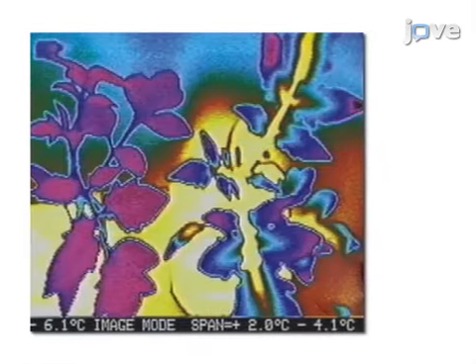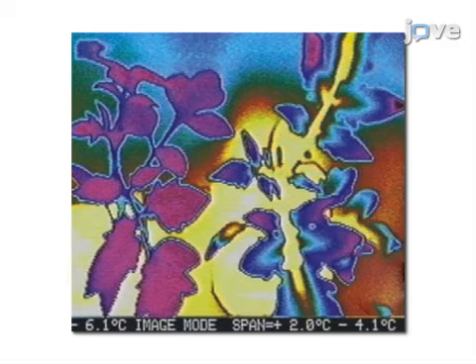The results show the effect of extrinsic ice-nucleating agents to induce plants to freeze rather than supercool and avoid freezing, based on the ability of infrared thermography to determine the exact location of ice initiation and to visualize how ice is propagated throughout the plant.